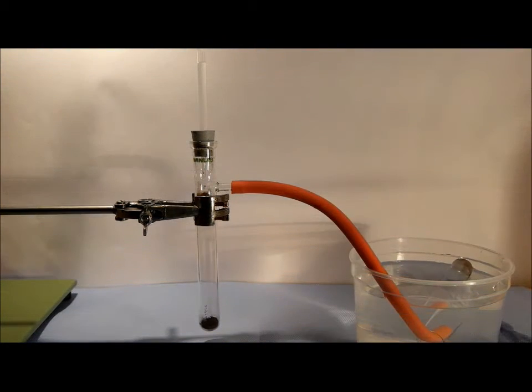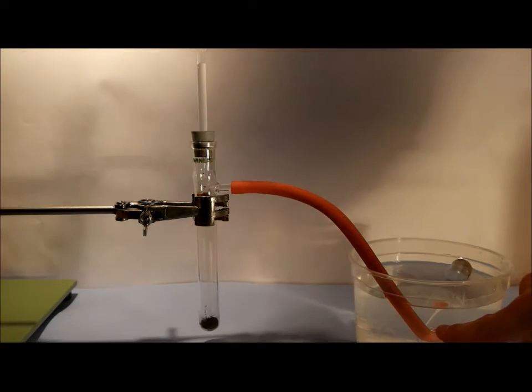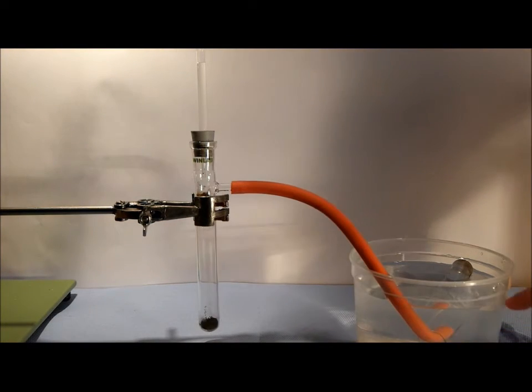As soon as you put pressure on your pipette the reaction will start and bubbles will get out of the tube in this water full test tube.